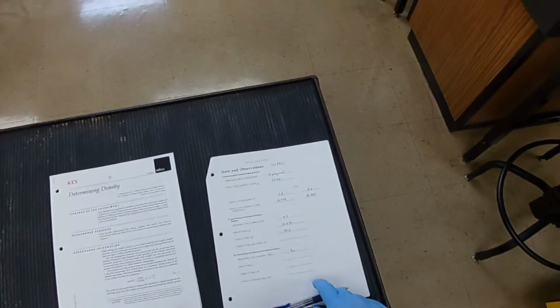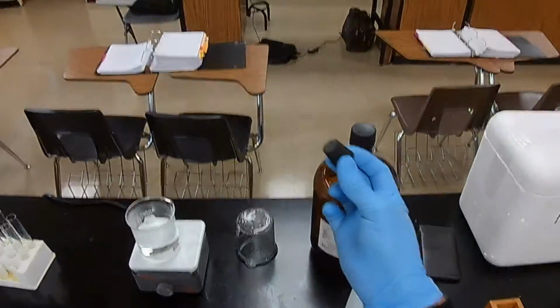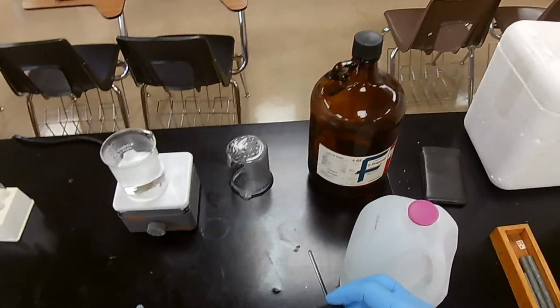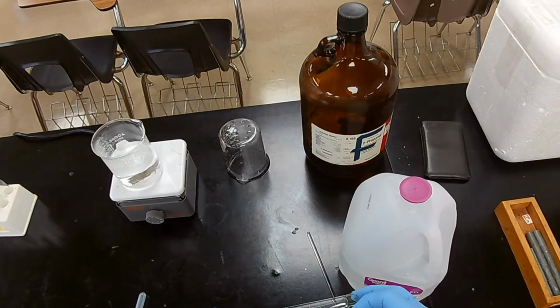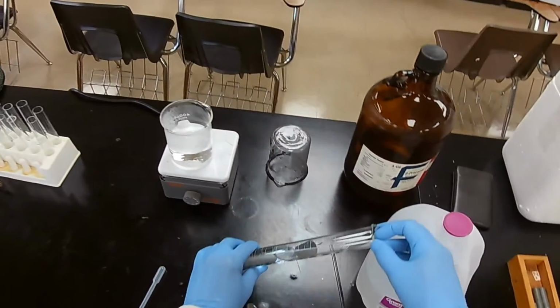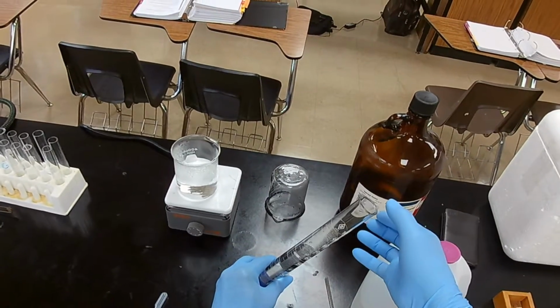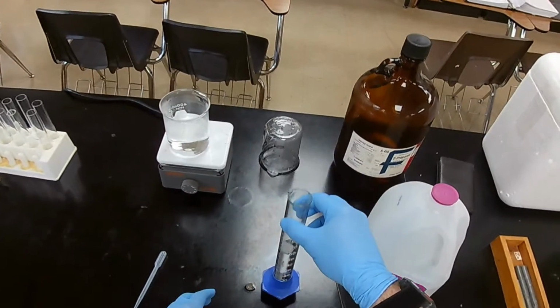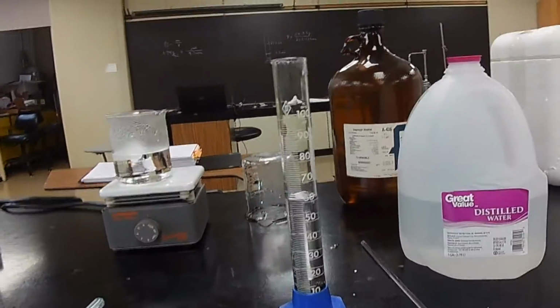Okay. Now we add the stopper to it. And the difference in volume before and after is the volume of the stopper. So we want to do it without splashing. All right, so we'll slide it in there and gradually lower it into the water. There we go. There you have it. Now let's measure the volume of water plus stopper.